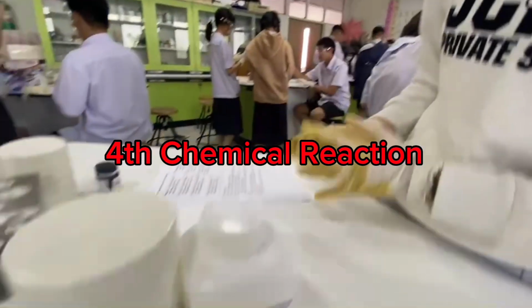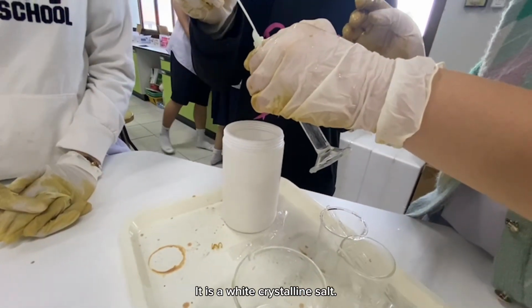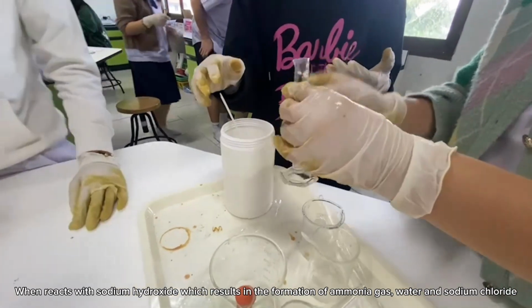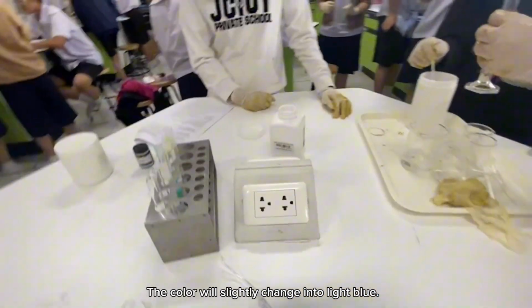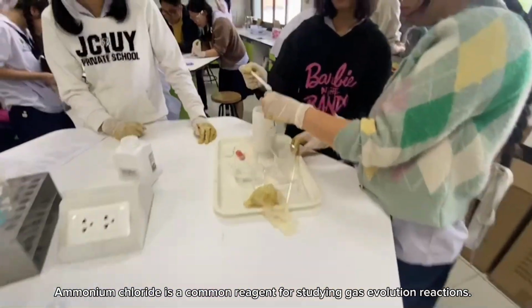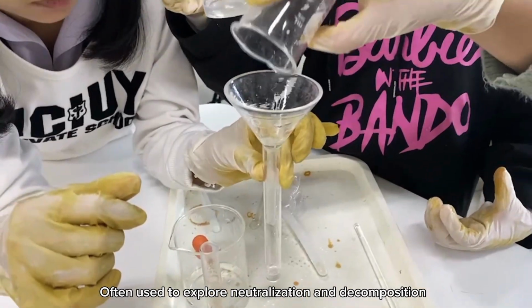Number 4. Ammonium chloride and sodium hydroxide. Ammonium chloride is an inorganic chemical compound. It is a white crystalline salt. When it reacts with sodium hydroxide, it results in the formation of ammonia gas, water, and sodium chloride, and the color will slightly change into light blue. Ammonium chloride is a common reagent for studying gas evolution reactions, while sodium hydroxide is a strong base often used to explore neutralization and decomposition.